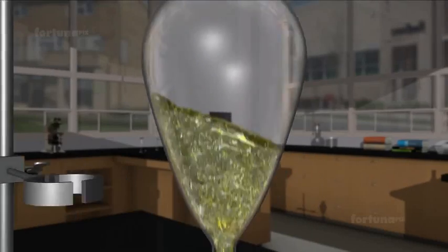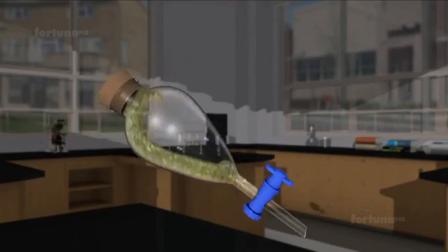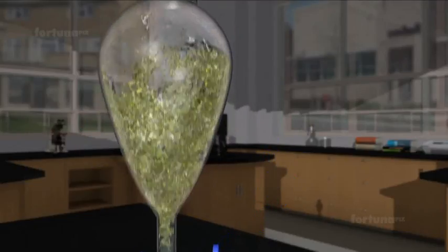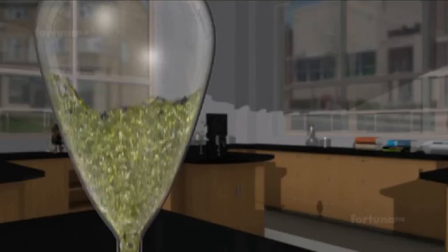we'll close the stopper. Shake the funnel gently and set it aside for several minutes. You'll see the two liquids beginning to pull apart.